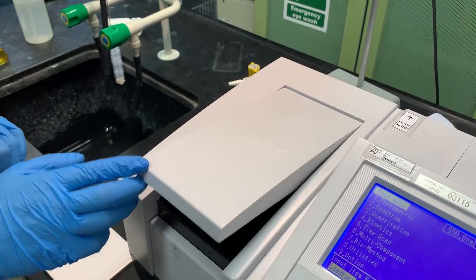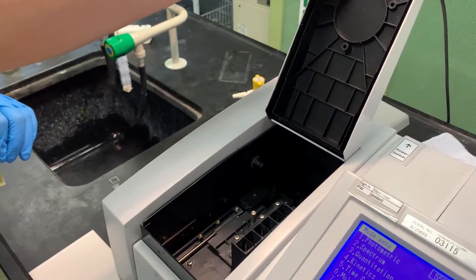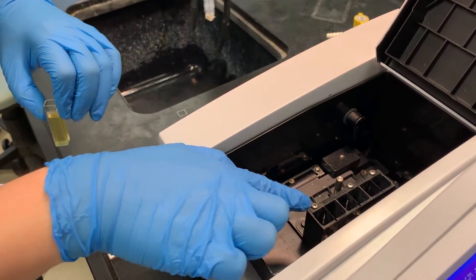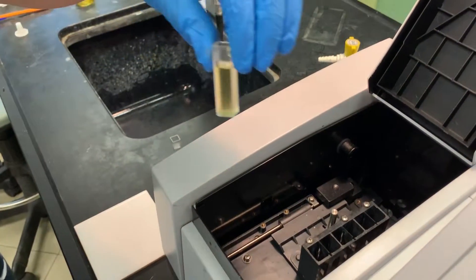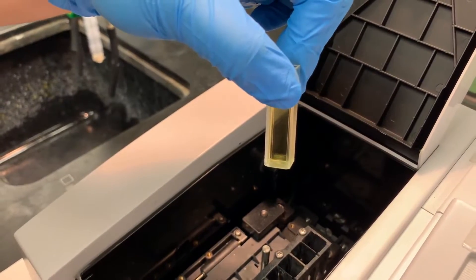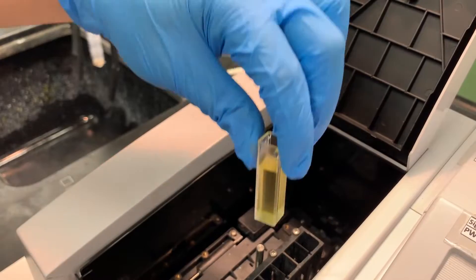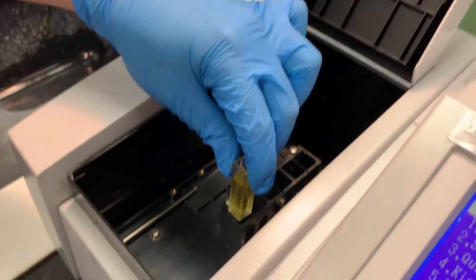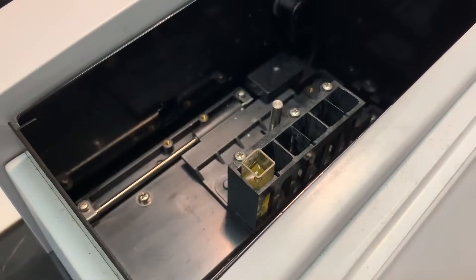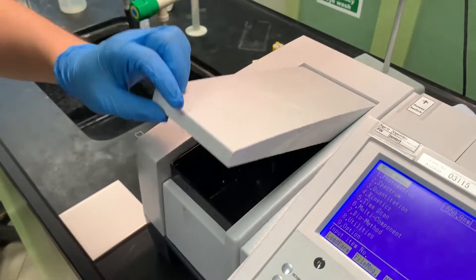Use the tissue paper to thoroughly wipe the clear sides of the cuvettes before use. Now we'll learn how to find the wavelength of maximum absorption of a substance. First, we need to calibrate the machine. To do so, insert the prepared cuvette containing a blank solution into the machine. Place the cuvette in the first slot from the bottom with the clear sides facing horizontally.